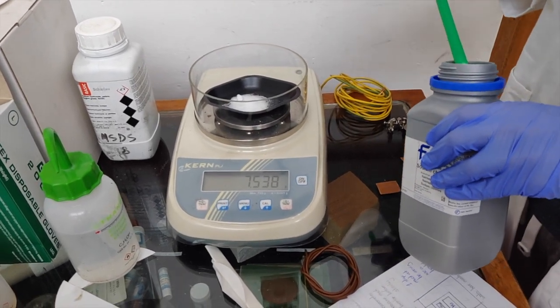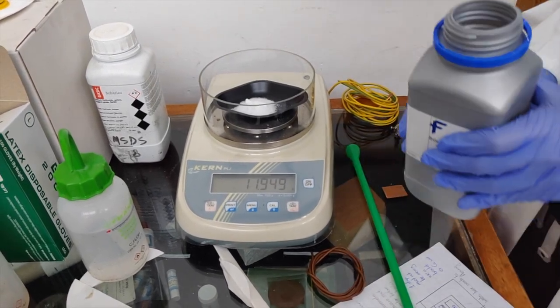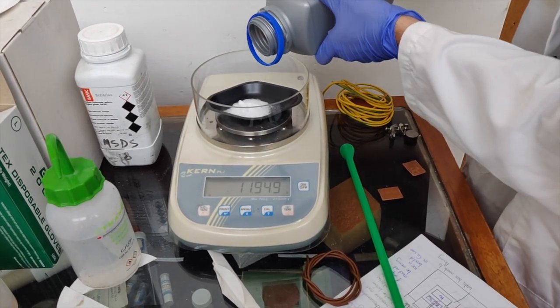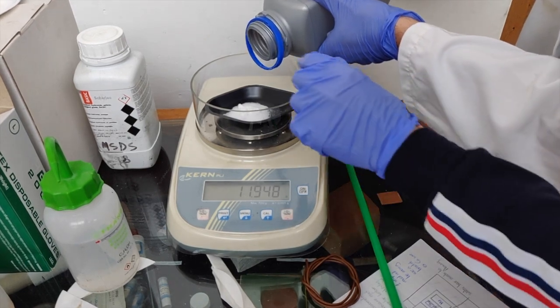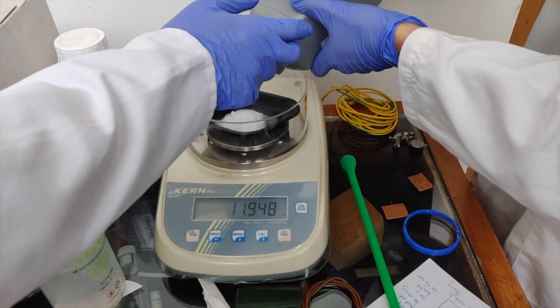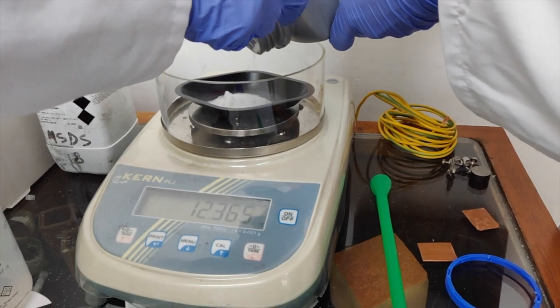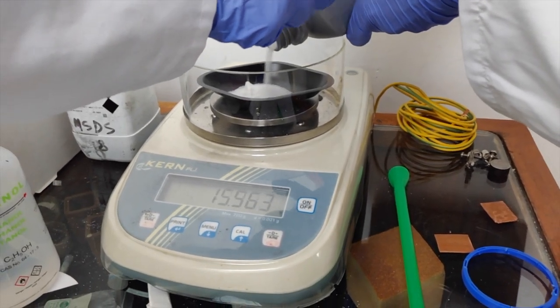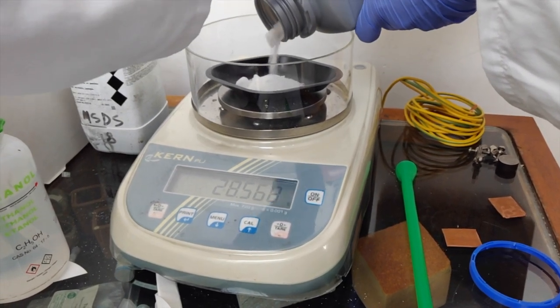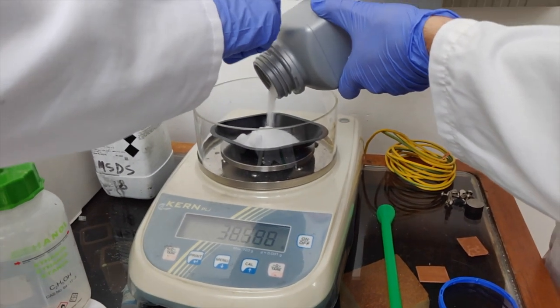Electrodes are electric conductors or semiconductors which release or occupy electrons, while an electrolyte is a medium responsible for the transfer of ions. With regards to the experiment performed, the electrodes were made out of copper, while the electrolyte was a sodium chloride solution. When a potential difference is generated in the electrochemical cell, the negatively charged ions move towards the anode, which is the positively charged electrode, and the positively charged ions move towards the cathode, which is the negatively charged electrode. This transfer of ions in turn carries the current.